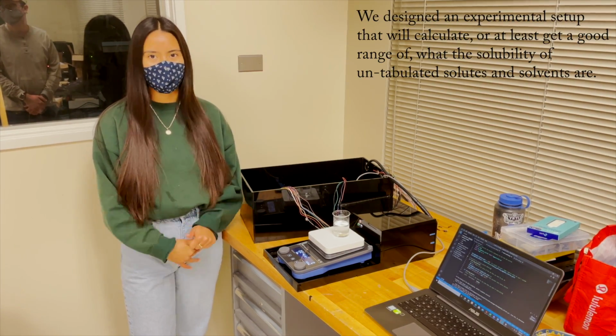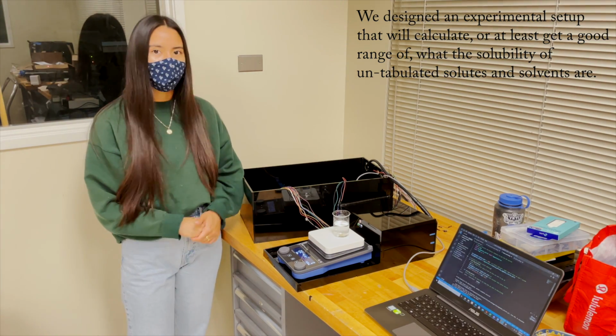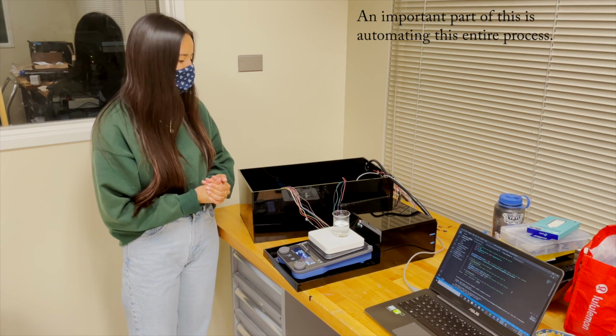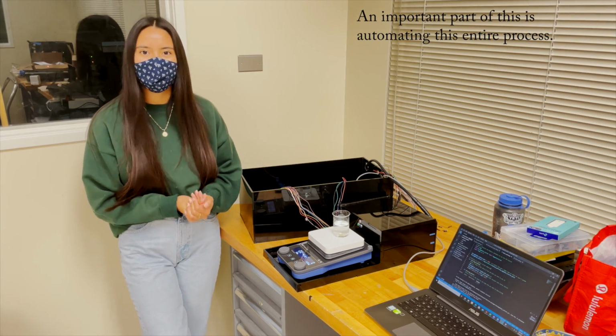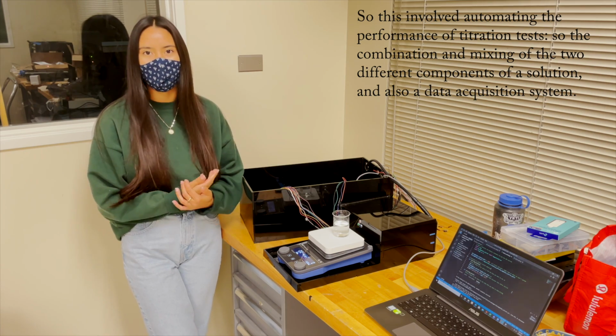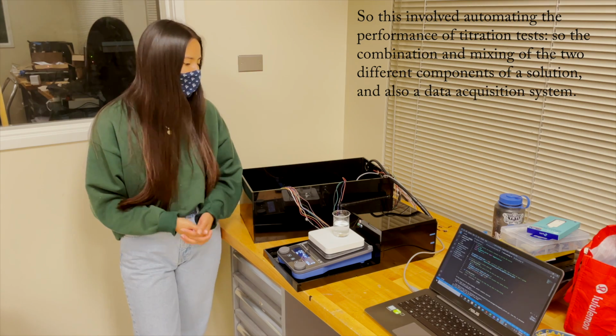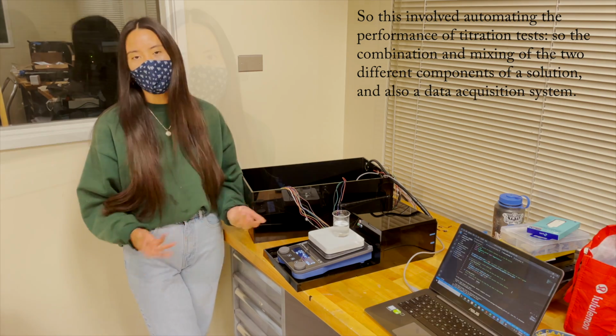We designed an experimental setup that will calculate, or at least get a good range of, what the solubility of untabulated solutes and solvents are. An important part of this is automating this entire process. So this involved automating the performance of titration tests, so the combination and mixing of the two different components of a solution, and also a data acquisition system.